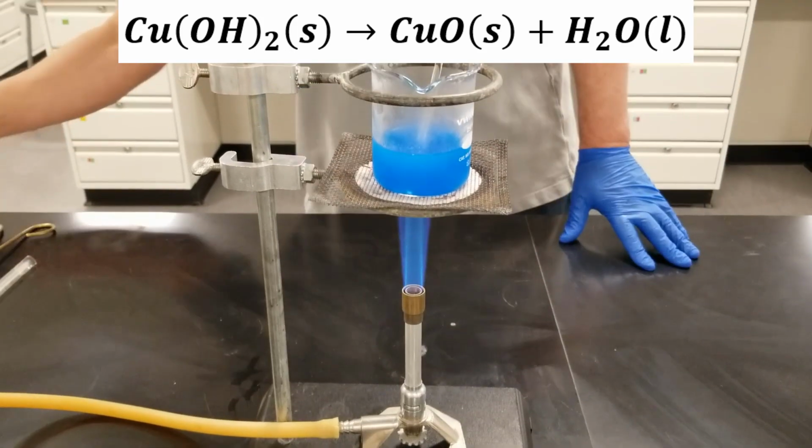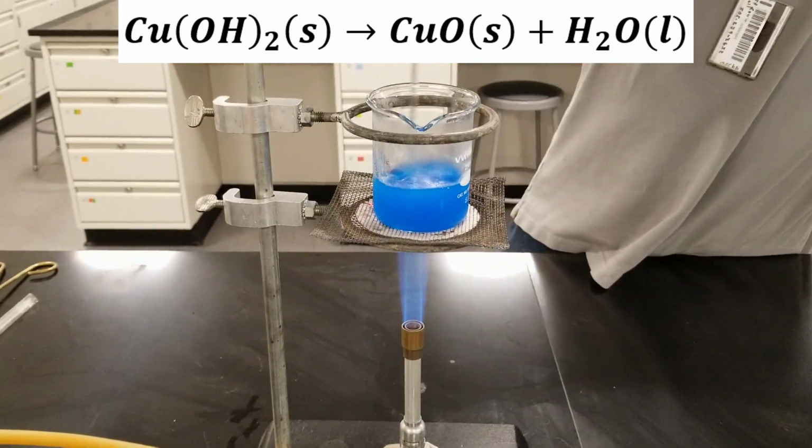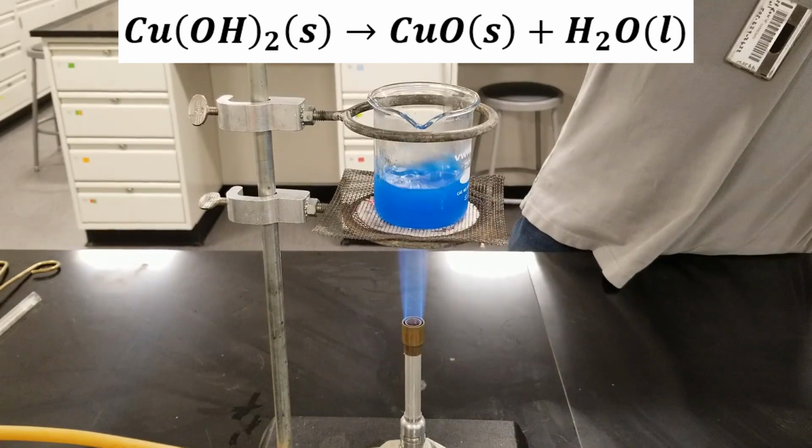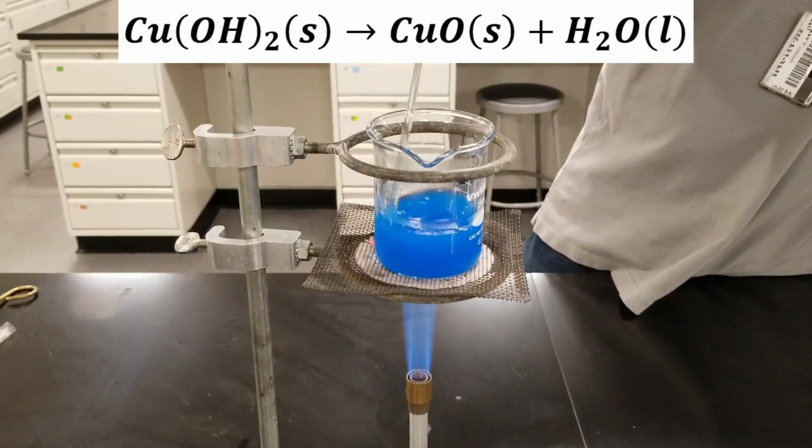If you heat them up, they turn into the corresponding oxide by eliminating water. So to heat this, we should have some boiling chips in there. We'll stir it continually until it boils, and at that point we should have our copper oxide.